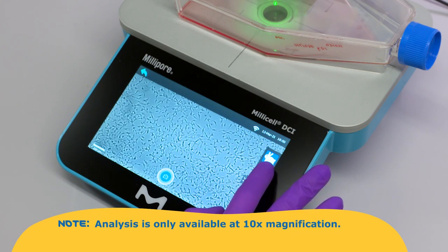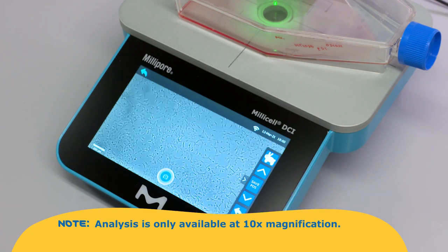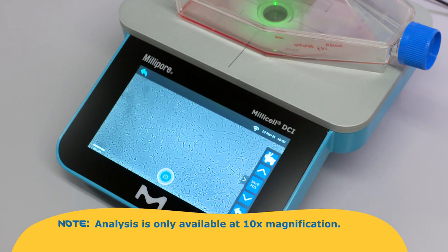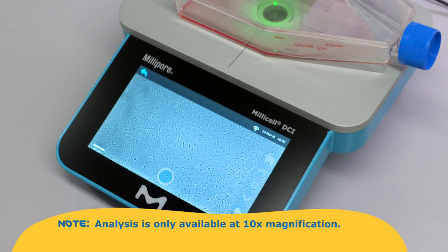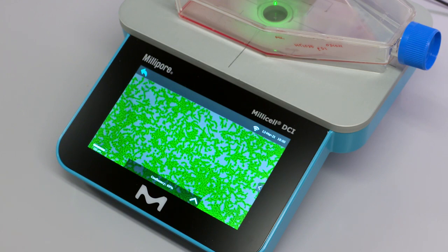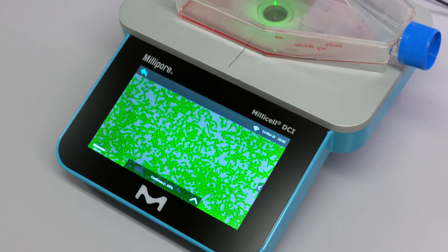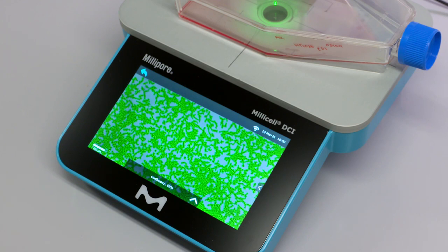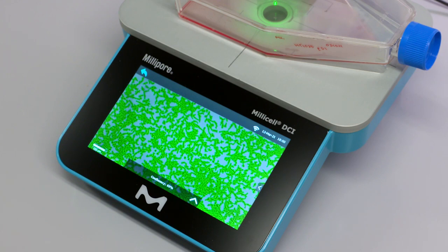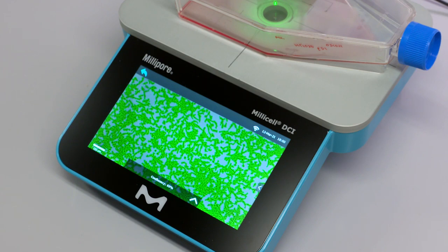Analysis is only available at 10x magnification. The green overlay mask indicates cell coverage, and the percent confluency will be displayed in the box at the bottom of the screen.